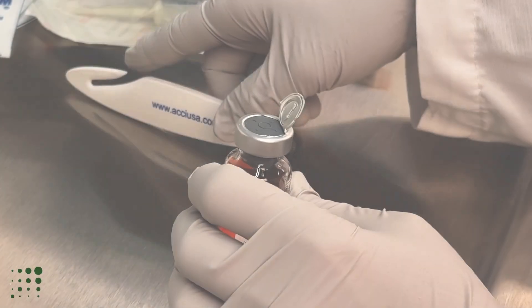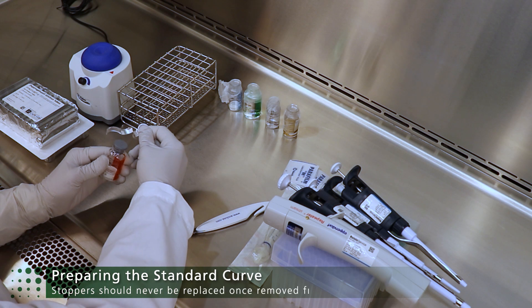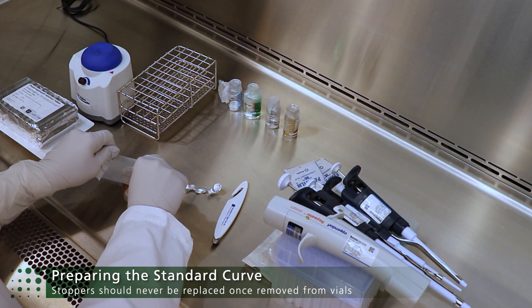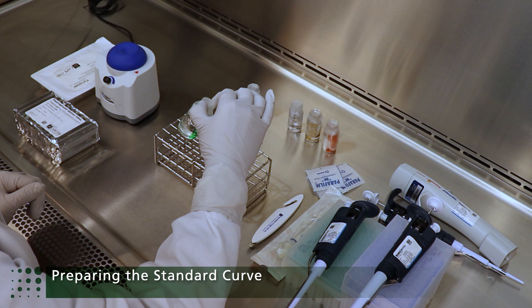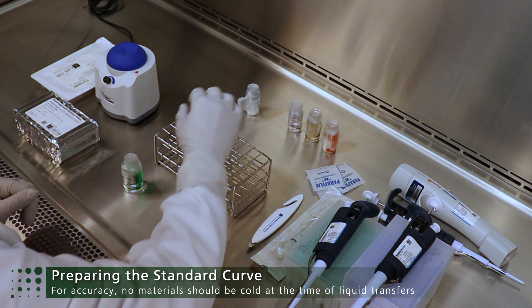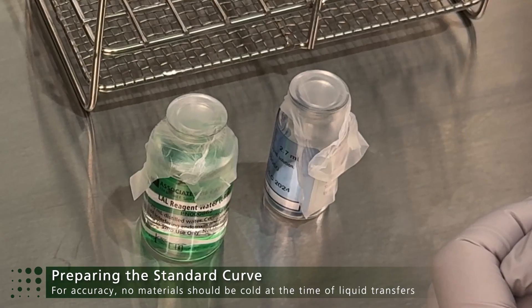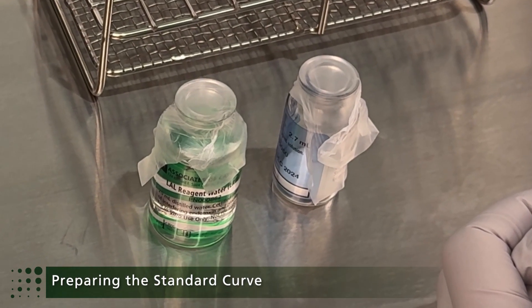With software selected and instruments and materials assembled, the workspace is ready for standard curve preparation. All vials should be uncapped and covered with parafilm. Unused components can be placed back into the fridge.